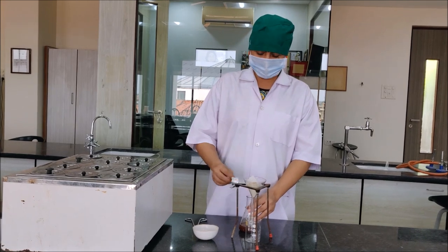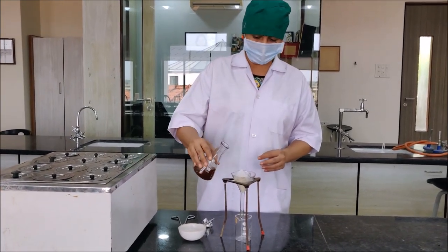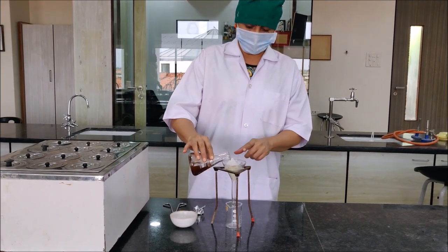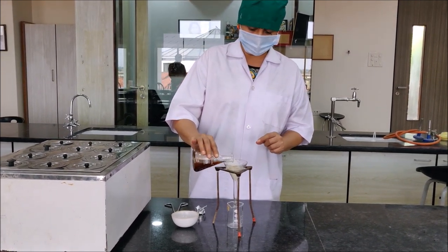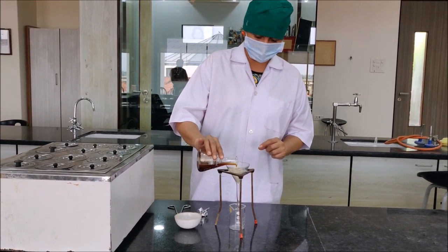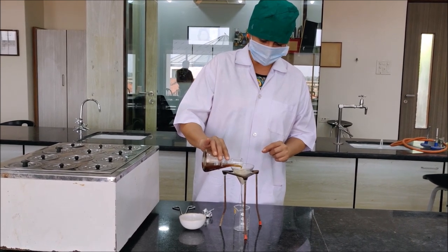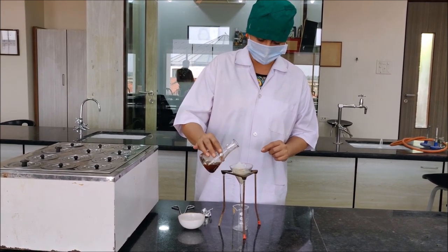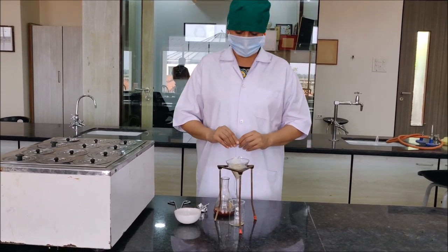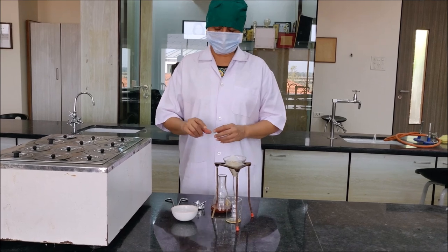After 24 hours, when the cold maceration extraction is completed, we will take a funnel and put wet filter paper into it. Wet it a little with alcohol so that it sticks to the funnel and start filtration. So the filtration has started. Once we complete the filtration we will move forward.